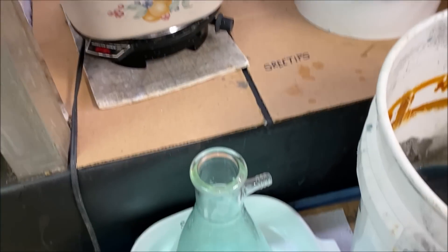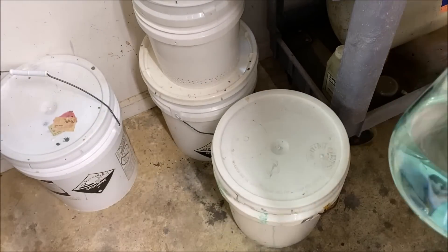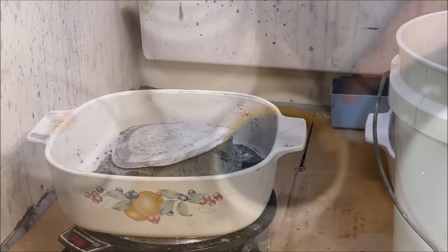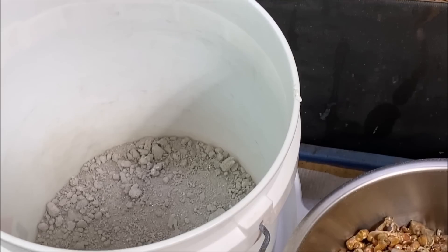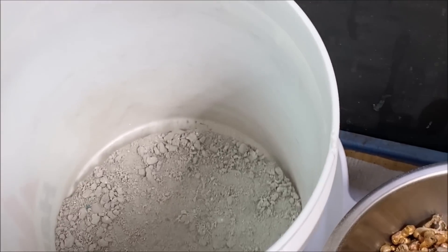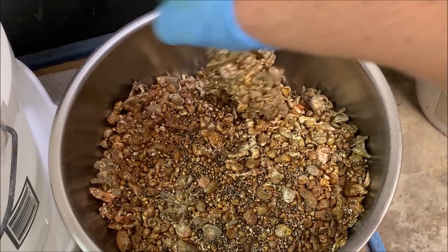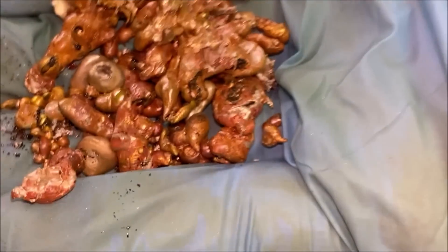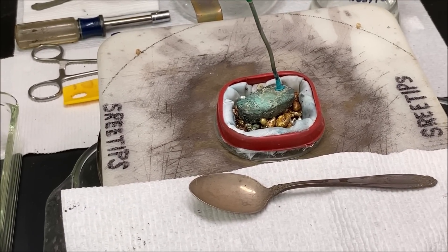We'll take our flask with the waste solution and add it to the bucket. Once the silver is completely dried, I transfer it into this plastic bucket. Then we melt it up in a furnace and pour it in water to form granules. Once we get it into that form, we add this impure silver to the silver cell here in the anode filter basket up top.